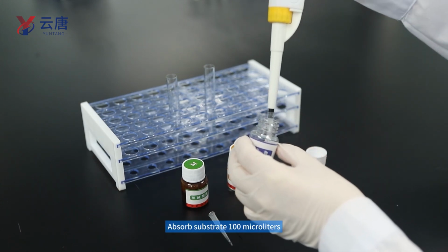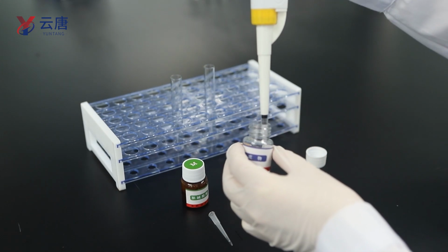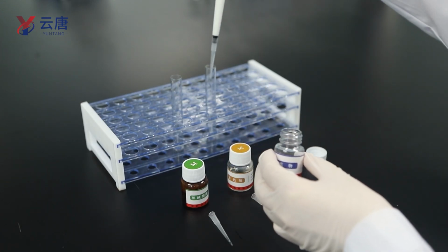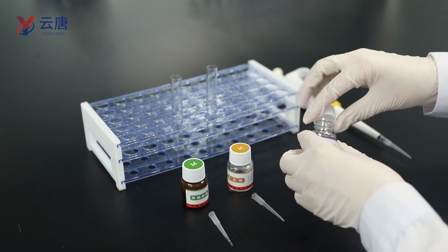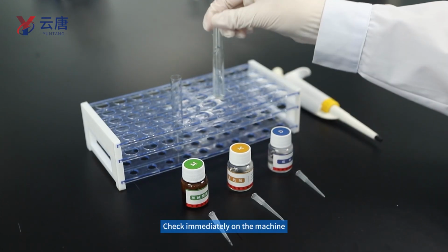Absorb substrate 100 microliters. Add to 2 test tubes separately. Shake mix. Check immediately on the machine.